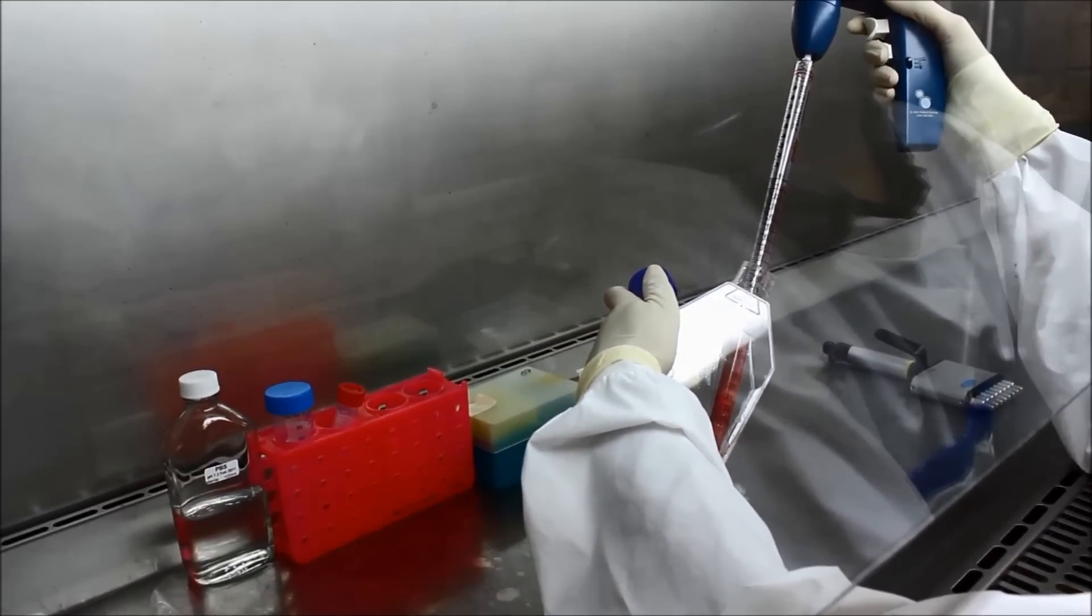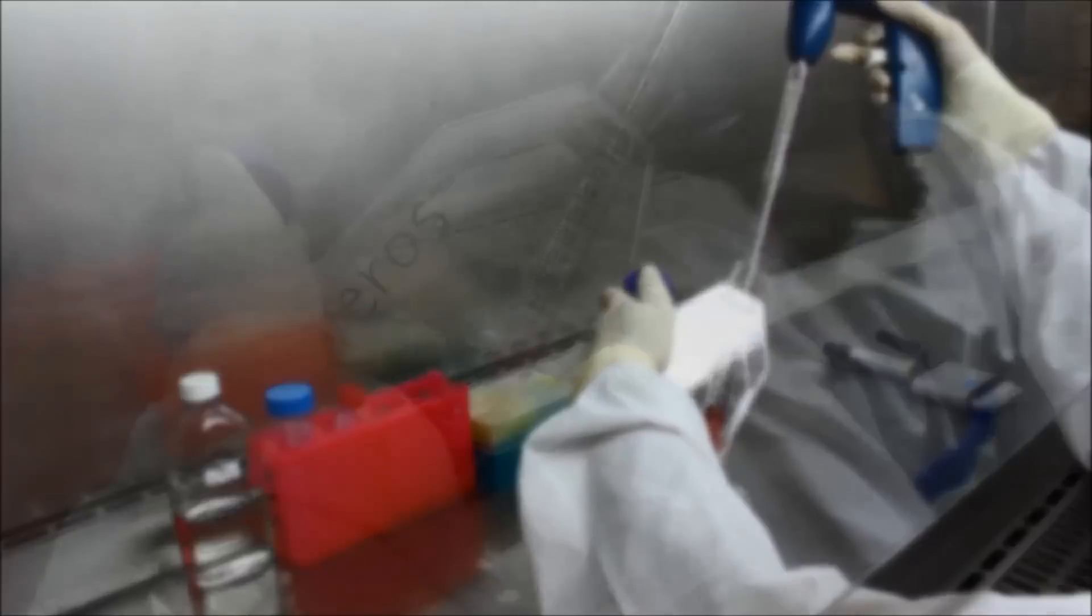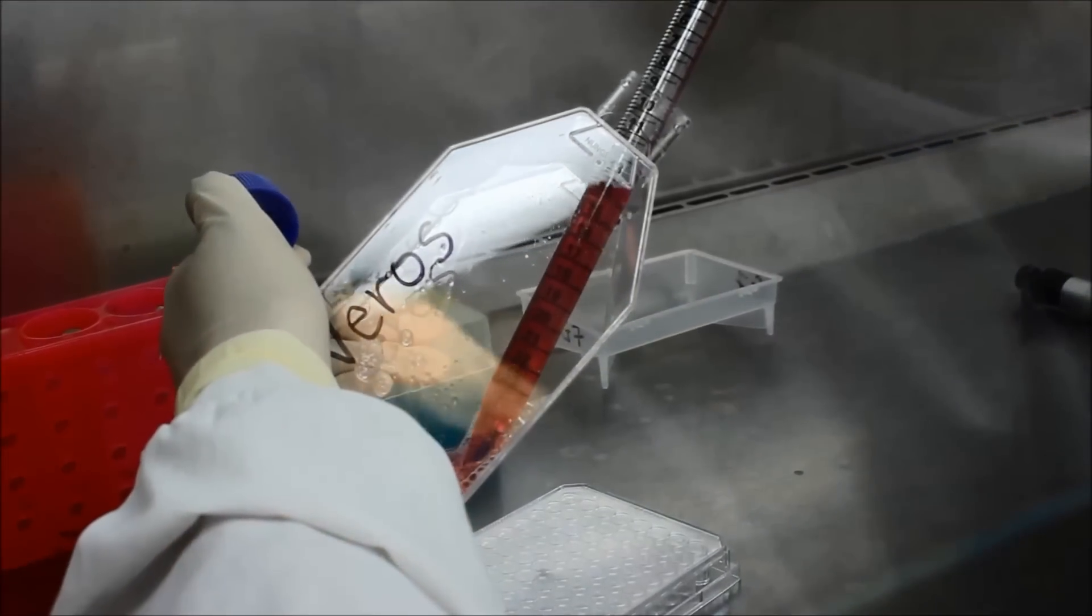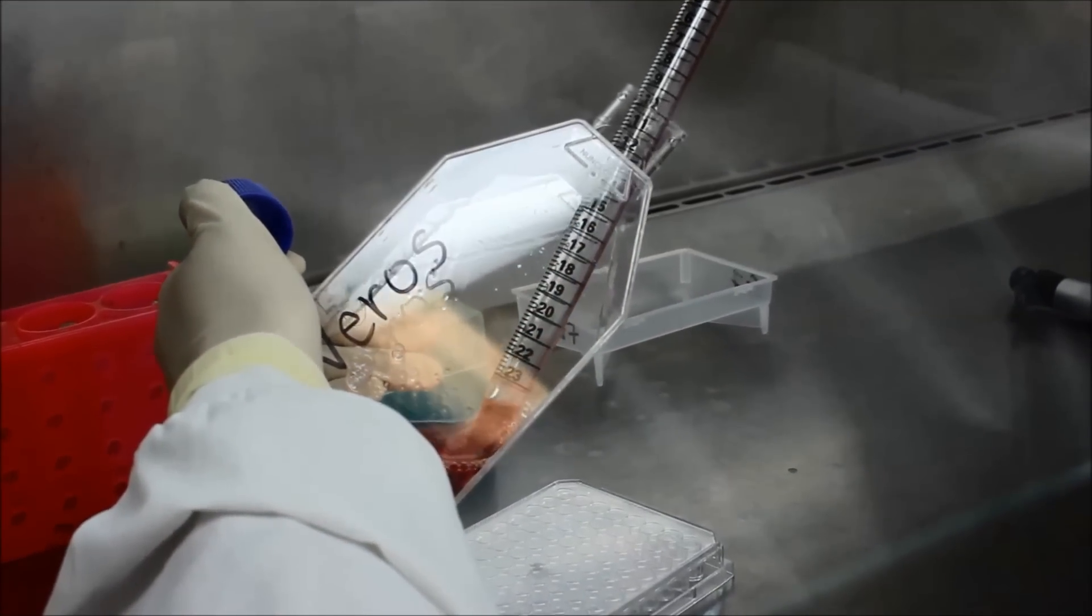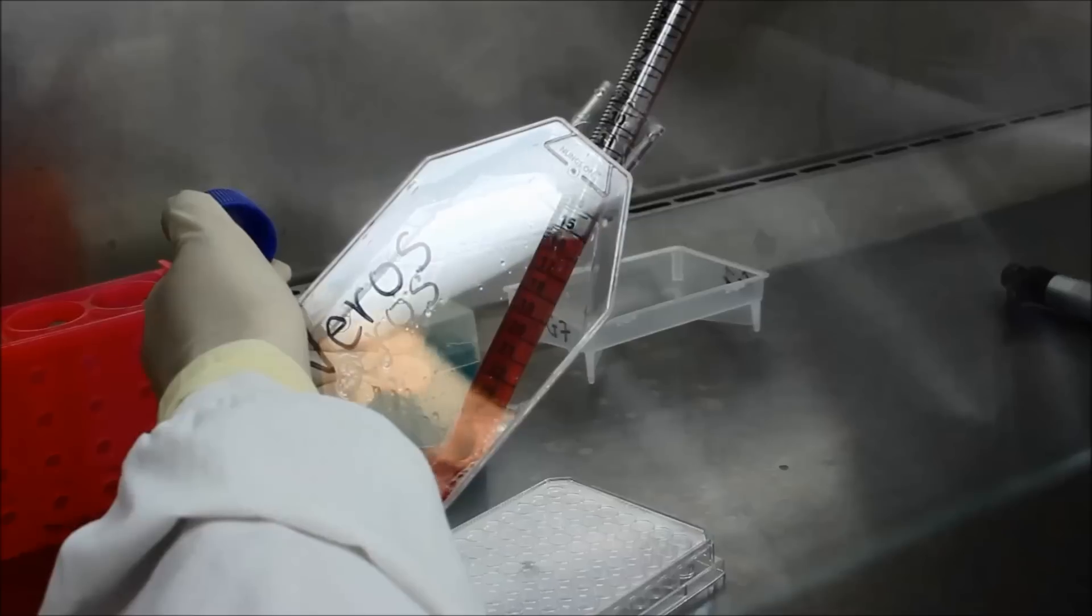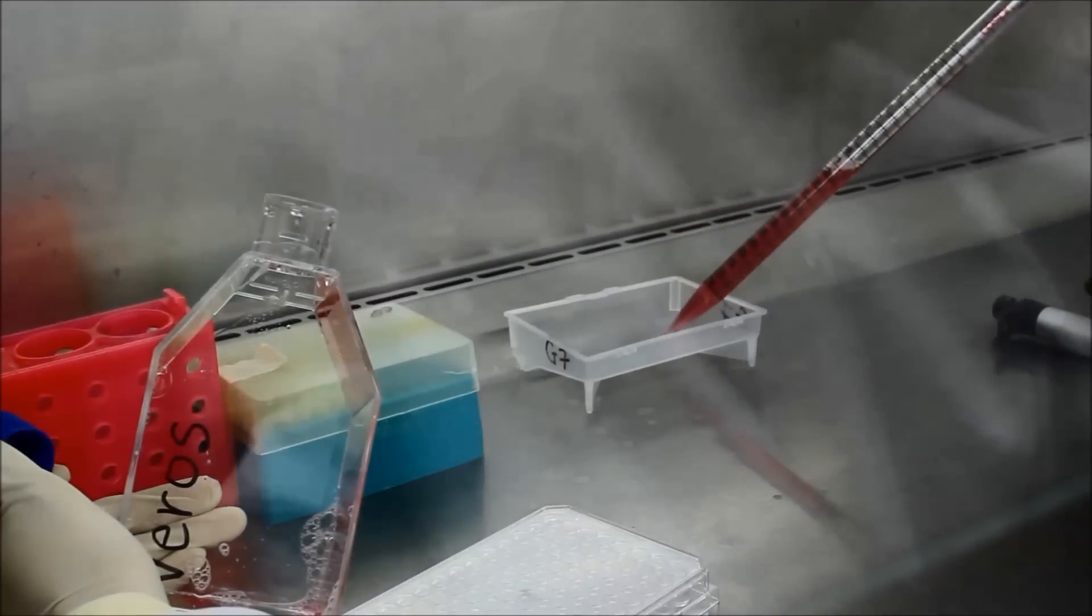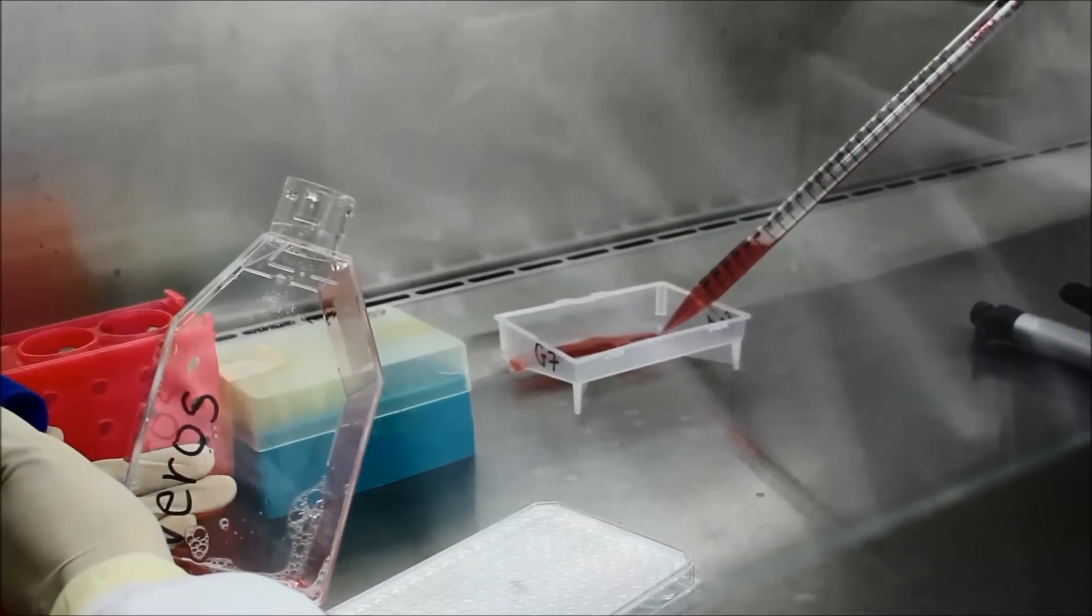By now your cells will have started to clump if left for a short while, so make sure to pipette them up and down to break up any cell clumps. Transfer this cell suspension to a sterile media tray.